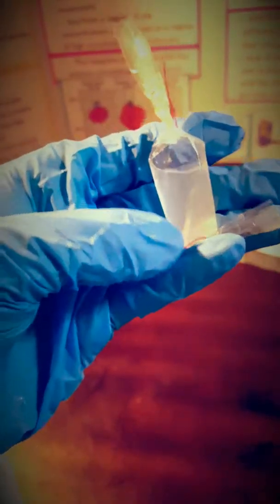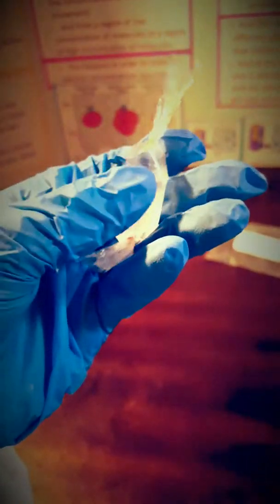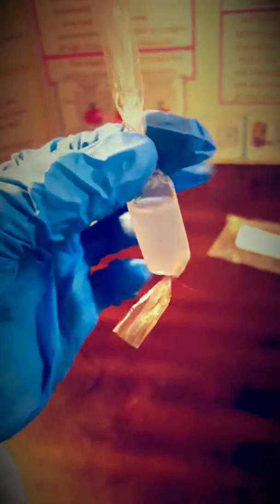We leave that space because our bag is working as a cell, right? So in a cell, water can come in and go out of the cell. That's called osmosis, right? It travels from regions of high concentration to regions of low concentration of water. But when it comes to solutions, it's traveling from hypotonic to hypertonic solutions.